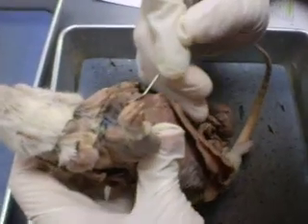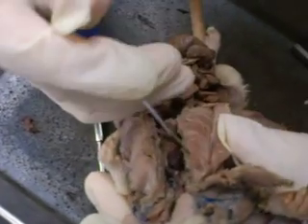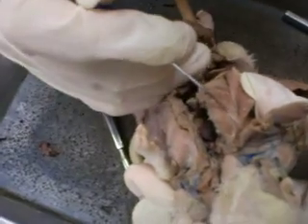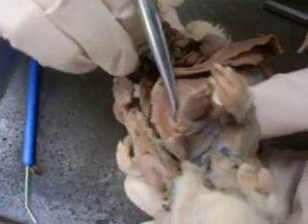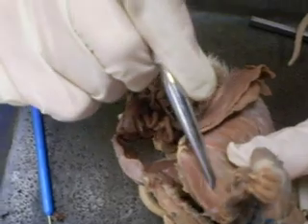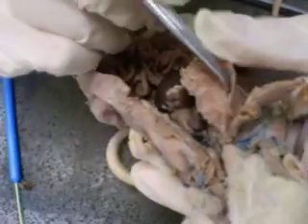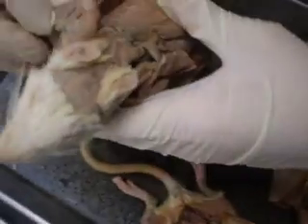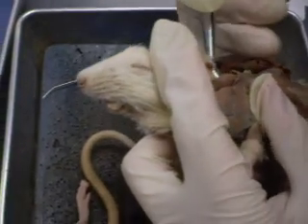You have your rectus thoracis, and then you have your rectus abdominis here. This part right here is the deep muscle, deeper part. It's your scalenus. You can see it kind of like right here as well. What is it? Scalenus. Where is it? Yeah, it's deeper here. And then this right here is your cervical trapezius.